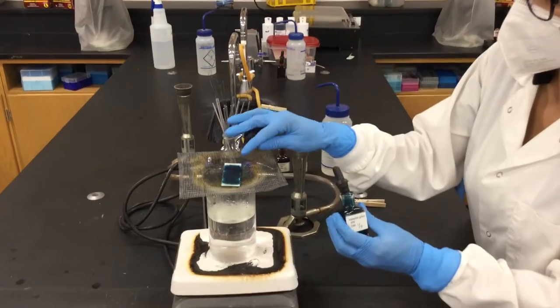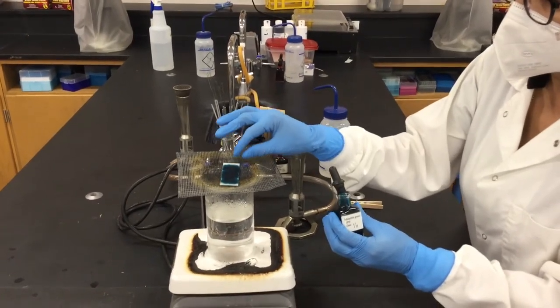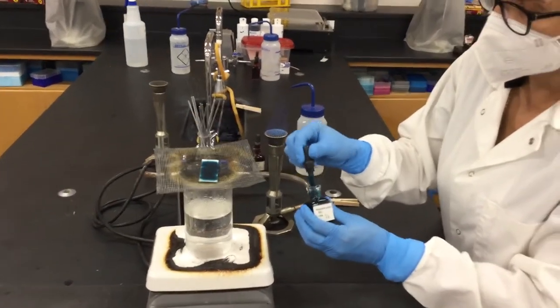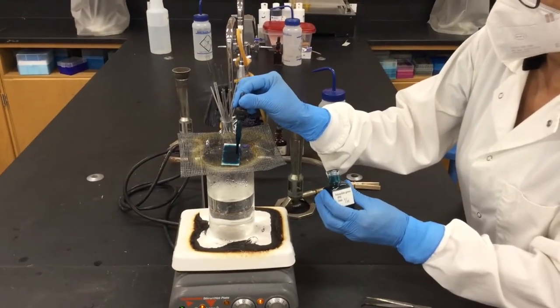And as you see, as this dye is drying from the paper towels, you keep adding more as it's needed.